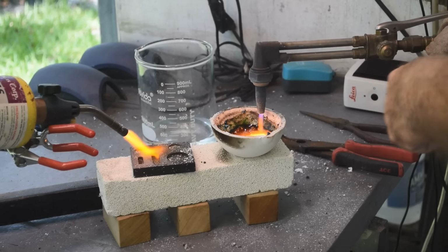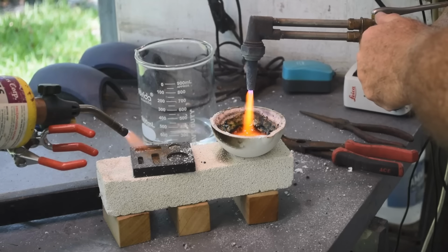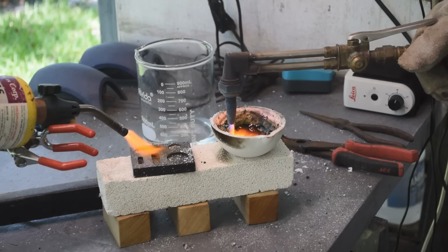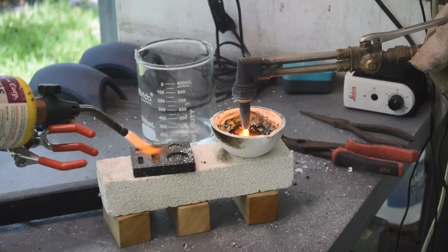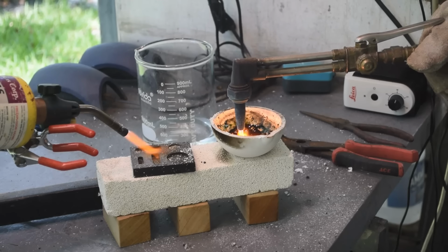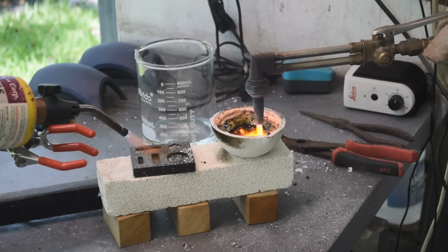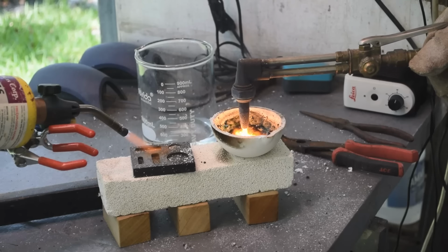Okay, this is what I was afraid of. This is what I was afraid of going in. My torch doesn't seem to be hot enough to melt the metal into a single button or bead. I can melt the metal in one spot by holding the torch directly over it. I keep turning the heat up on the torch too. You know, this has been going on a lot longer than you've seen. I keep turning the heat up.